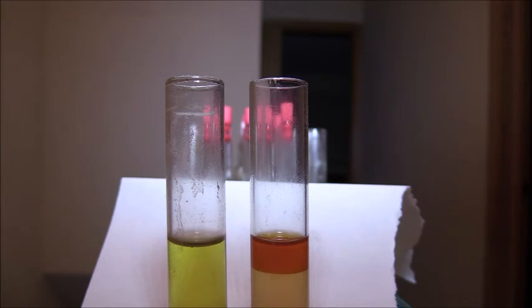But before I say conclusively what the top layer is, I'm going to put a sample from the two test tubes under the microscope. Hopefully if there are fatty acids in my sample solution, they should show up as reddish vesicles much like the vesicles that we saw earlier in videos on this channel.